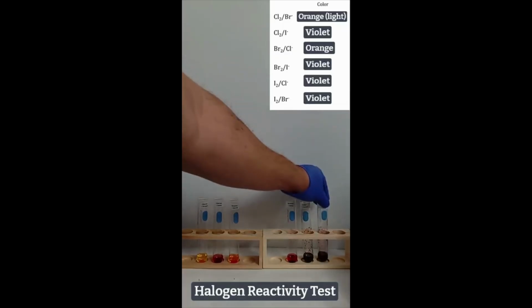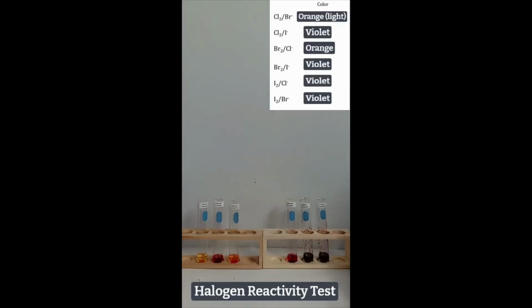Halogen displacement occurred in 3 specific reactions. Test tube 1 formed bromine, while test tubes 2 and 4 formed iodine. The remaining test tube left the halogens unchanged.